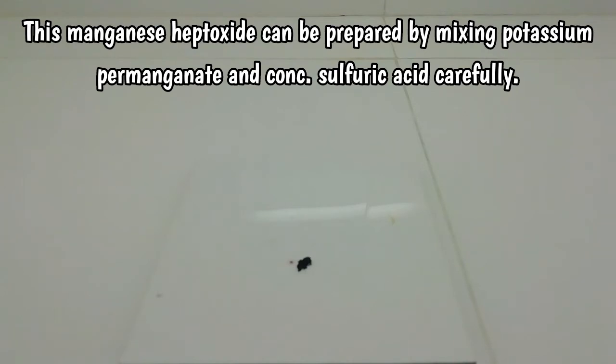Therefore, here I have a very little amount of potassium permanganate. Then I am going to add 2 drops of concentrated sulfuric acid. After that, I am going to mix this chemical very carefully.